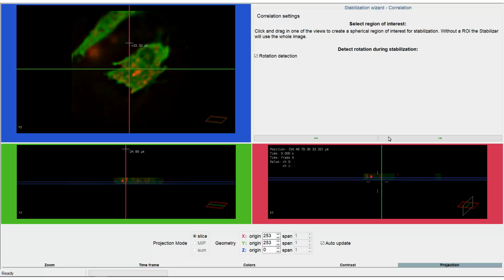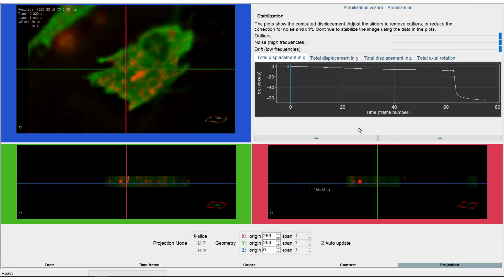After clicking the next button, Huygens will compute the displacement of the image. You can see the progress being made in the highlighted area. After this process is complete you can adjust the computed displacement with the sliders to remove outliers, or to reduce the correction for noise and drift. Below the sliders you can view the displacement in X, as well as in Y.